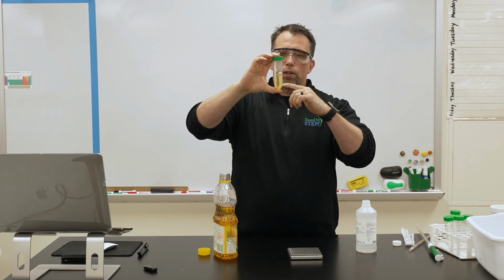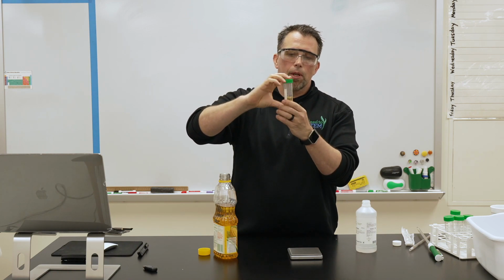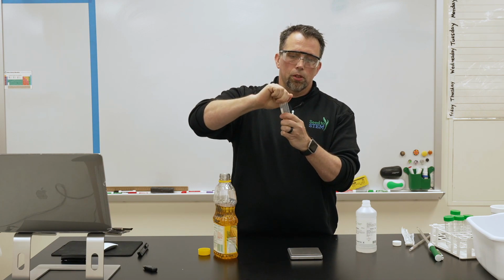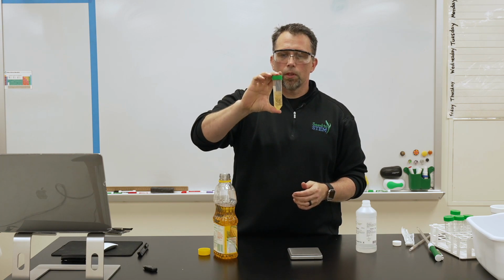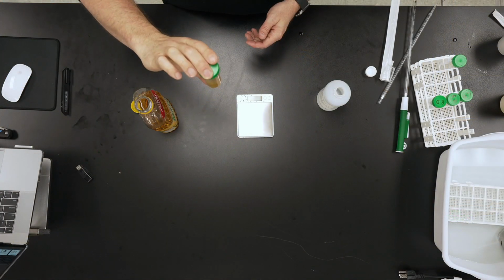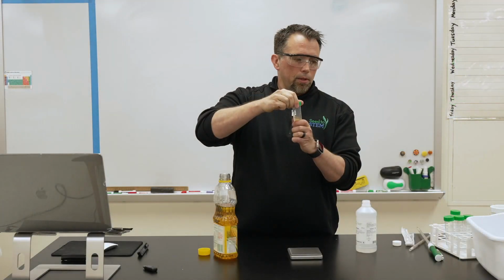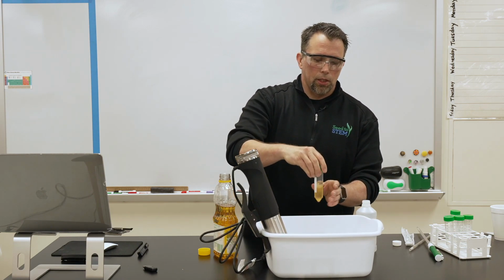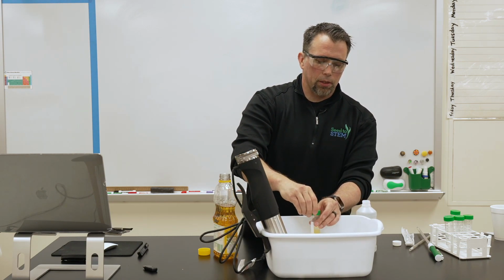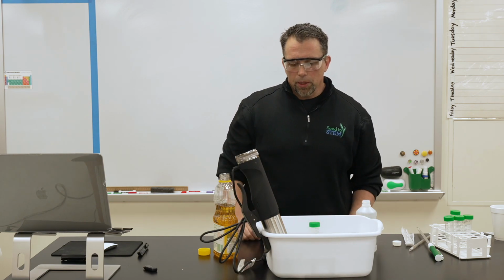Okay, now if you notice, the oil is at the bottom and the methanol, or the catalyst, is at the top. So you put the lid on good and tight and gently invert that a few times. Try to get that mixed up good. Don't want to shake it up. And if you want to speed the reaction up, you can use a warm water bath set to 50 degrees Celsius, and just set this in a test tube rack. You want to, again, vent the lid just a little bit so it doesn't build up any pressure with the increase in temperature. And typically let that sit overnight.